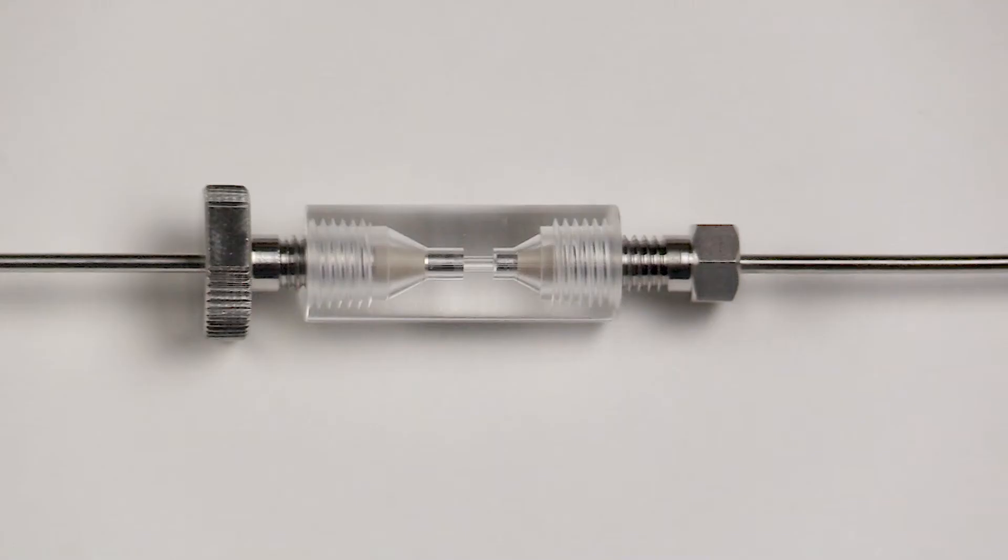For stainless steel tubing, we recommend pre-cut tubing, especially for column connections. When the tubing is seated properly in the bottom of the port, it minimizes leaks and dead spots where sample can accumulate and lead to carryover.